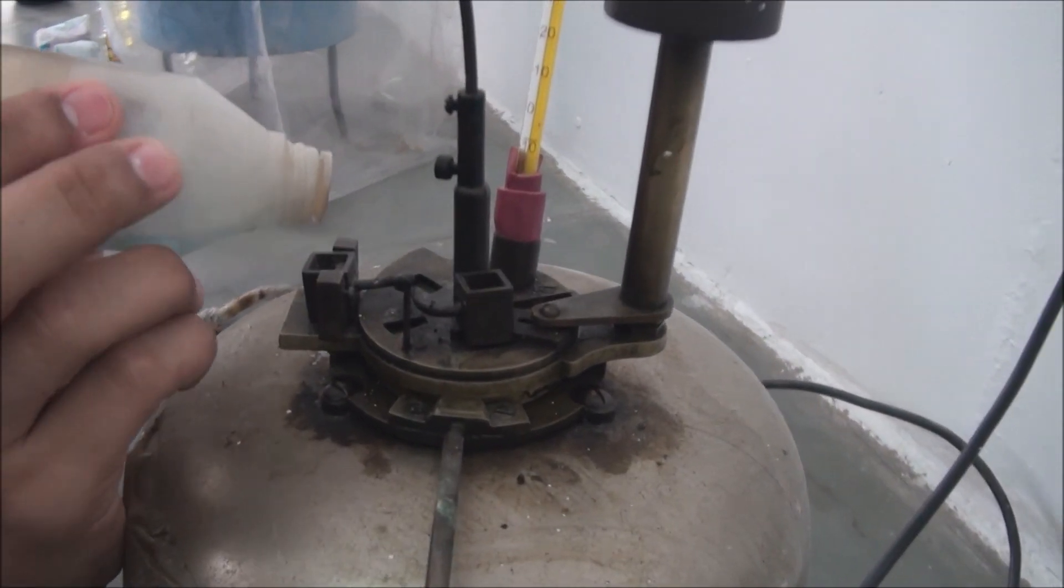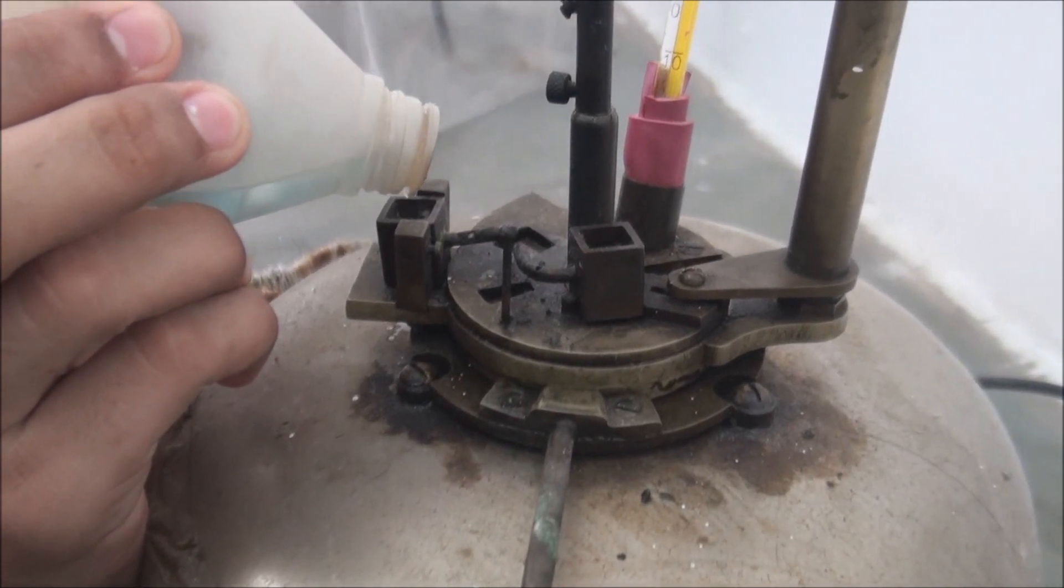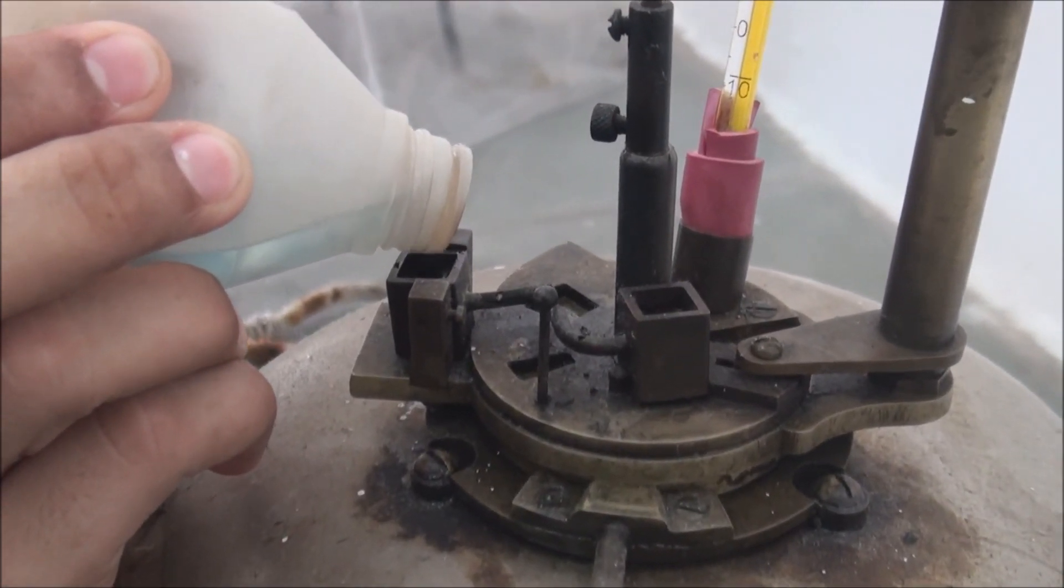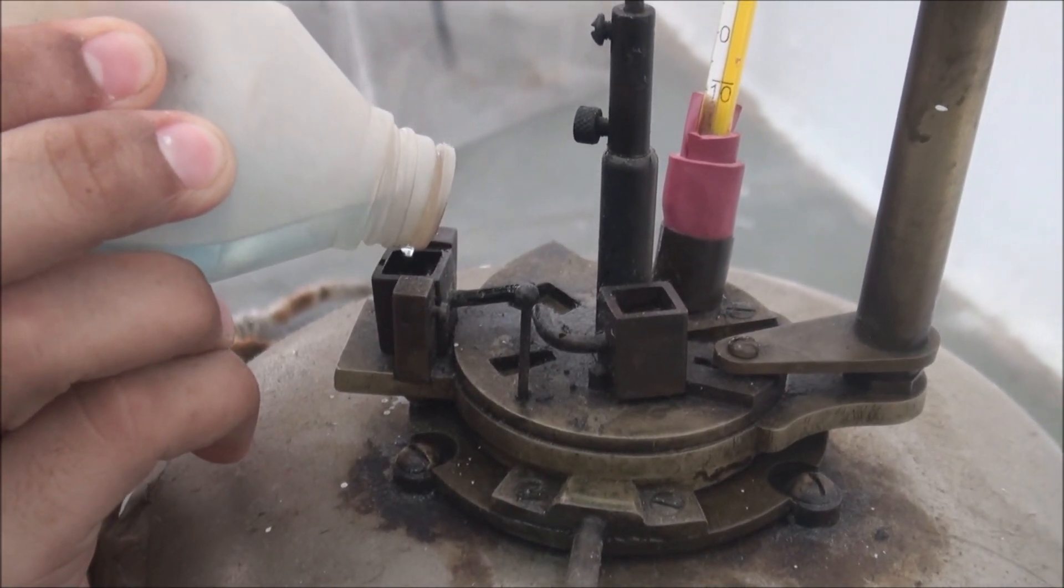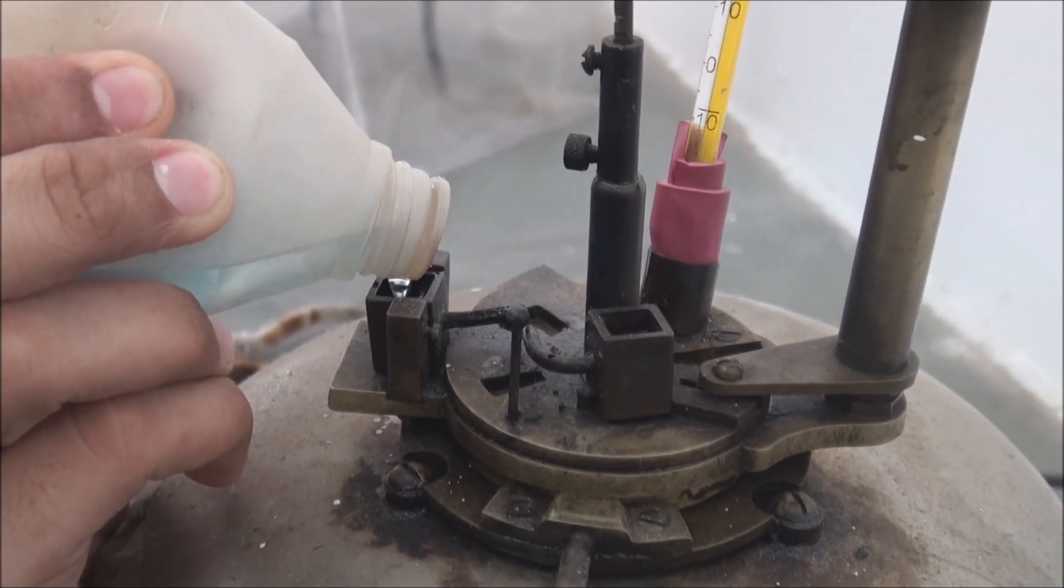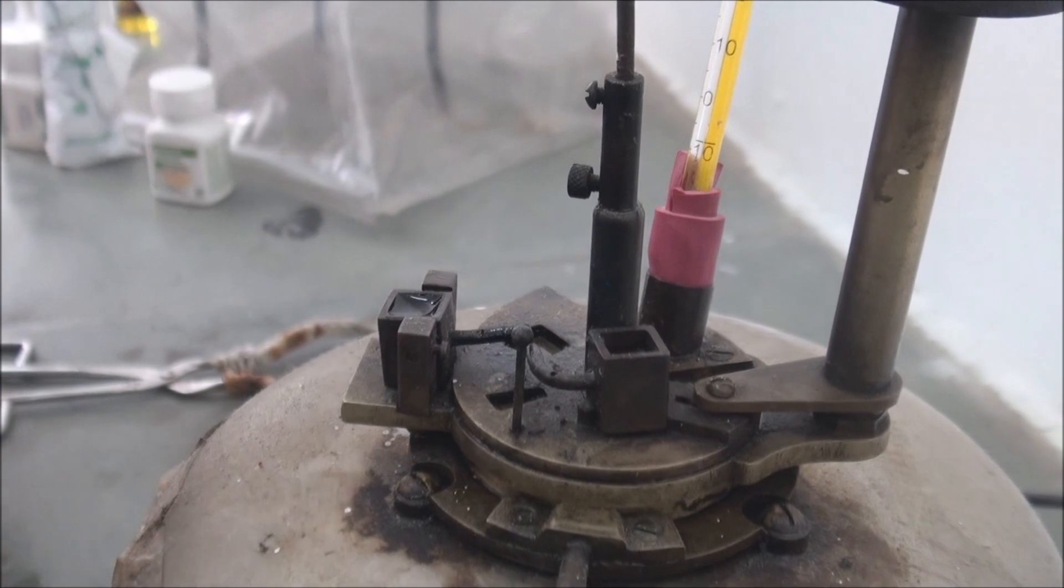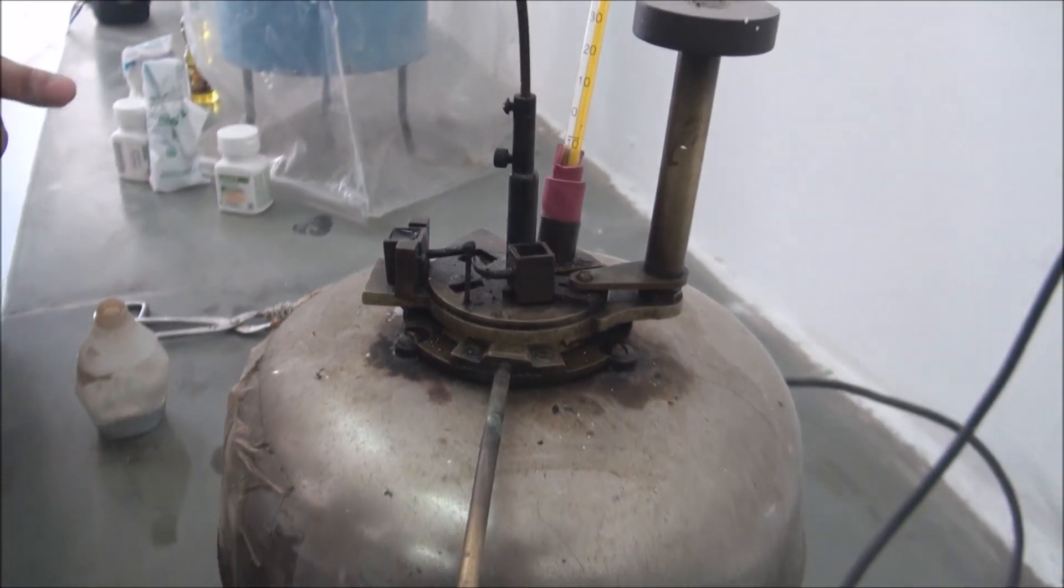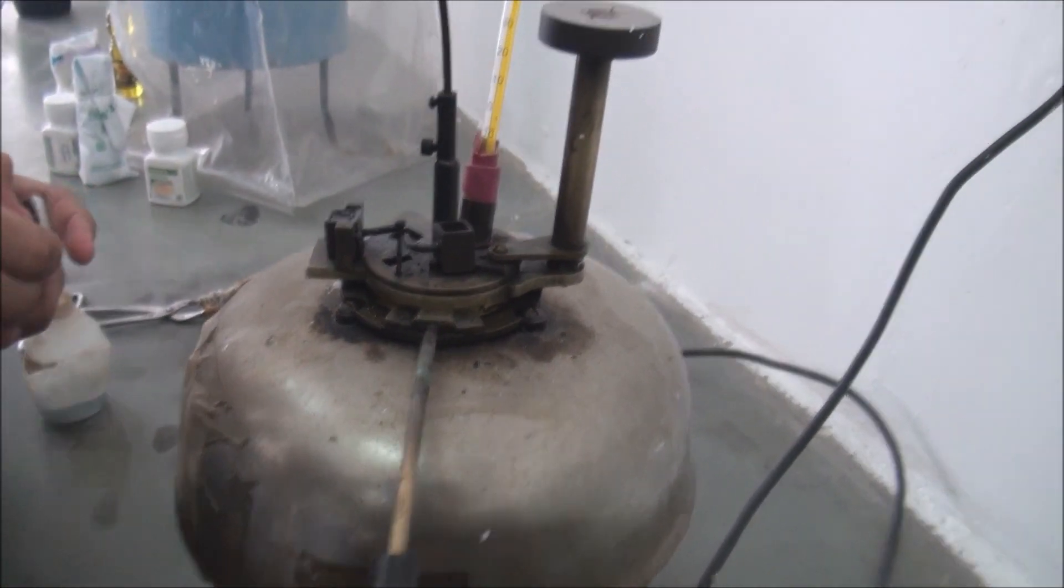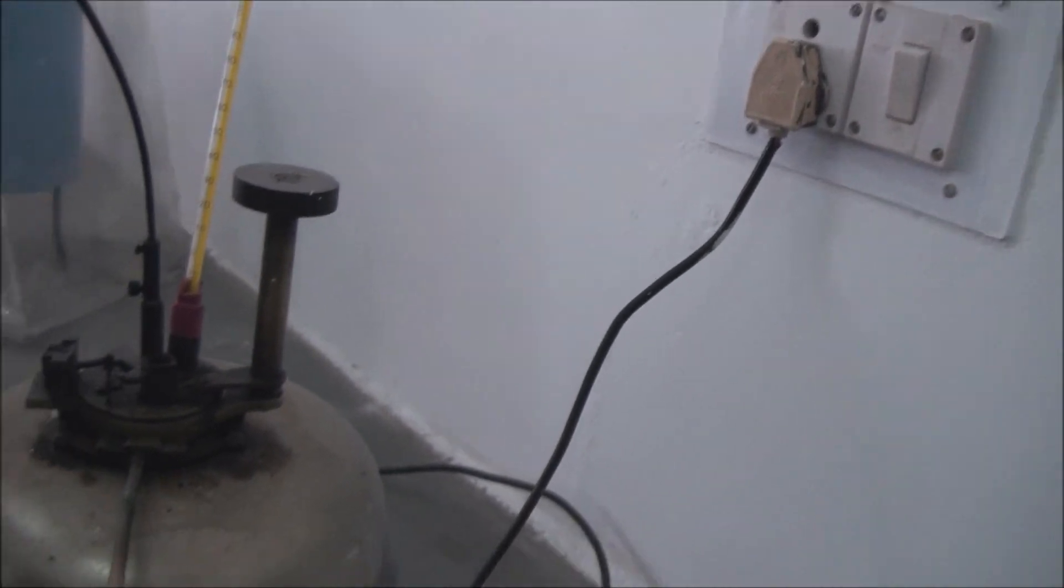Now, add adequate amount of kerosene in the vessel provided for the same. Using a fire source, ignite the kerosene as shown in the video. Start the heater.